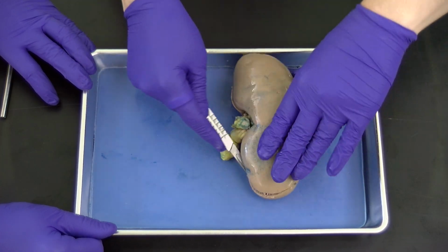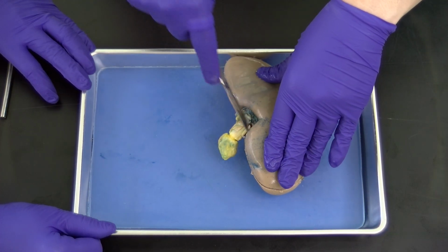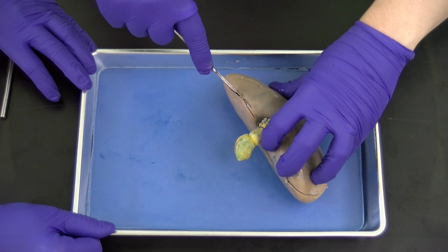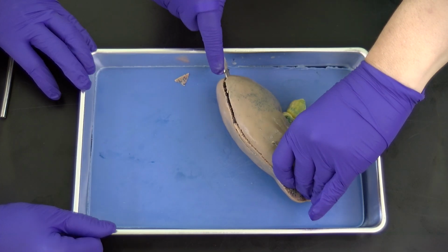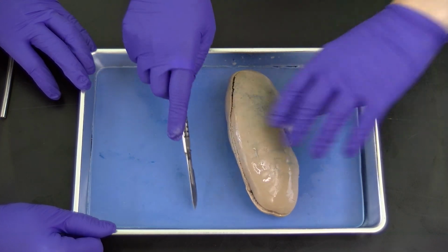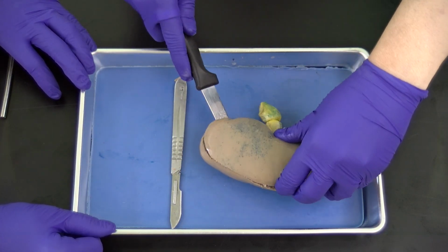This is much harder than it looks, folks. And if you don't have to try this at home, don't do it. But if you do have to try it at home, be very careful. Never cut toward your fingers. Always cut away from yourself. Yep, always away. It's not as easy as it looks, folks. I don't think you're making it look easy. It does not feel as easy as it looks, which is not easy at all.